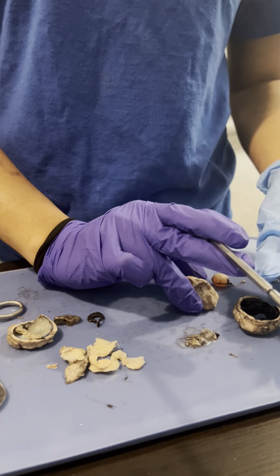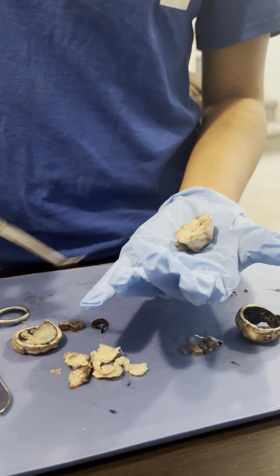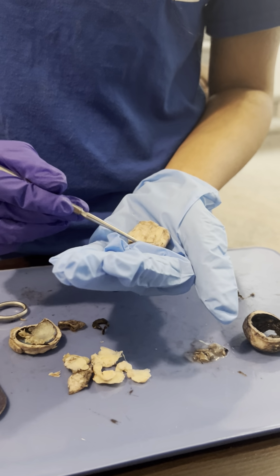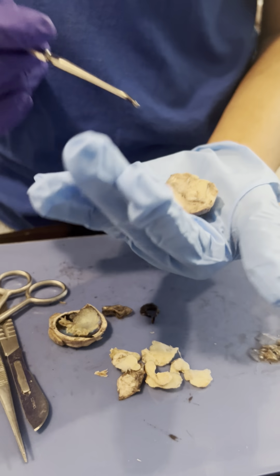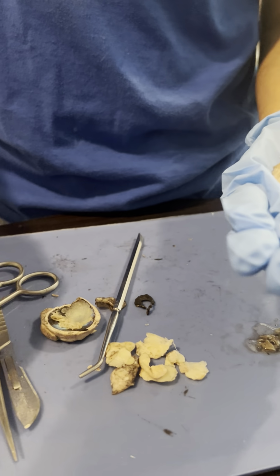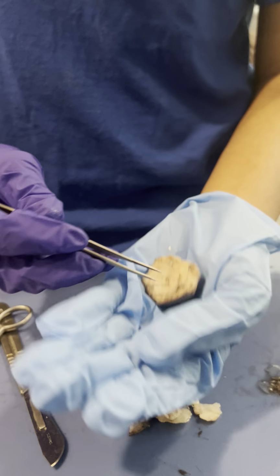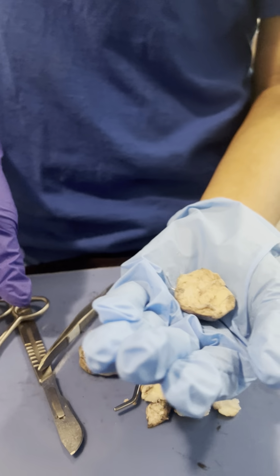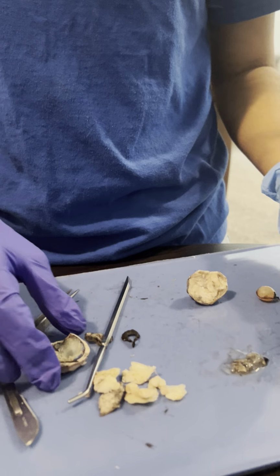The first cut I made was a bit too shallow and didn't reach the back part of the eye, so I did have to make another cut, but this allowed us to see the optic nerve much more clearly, since you couldn't see as well in the back. But here we have the optic nerve, and if I pinch it, you can kind of see the different bundles that make it up. The optic nerve is just a bunch of nerves that send signals from the eye to the brain.